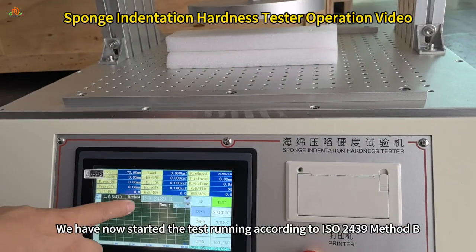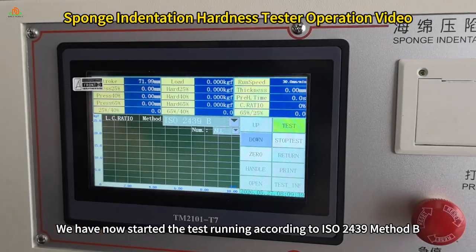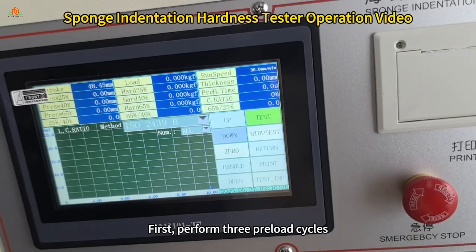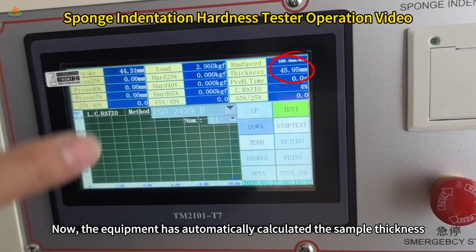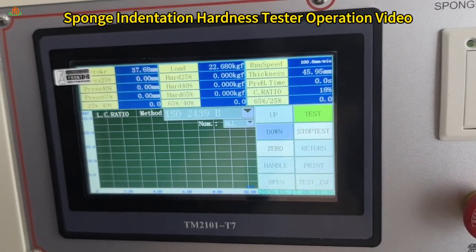We have now started the test running according to ISO 2439 method B. We'll check the results later. First, perform 3 preload cycles. Now, the equipment has automatically calculated the sample thickness, this much.